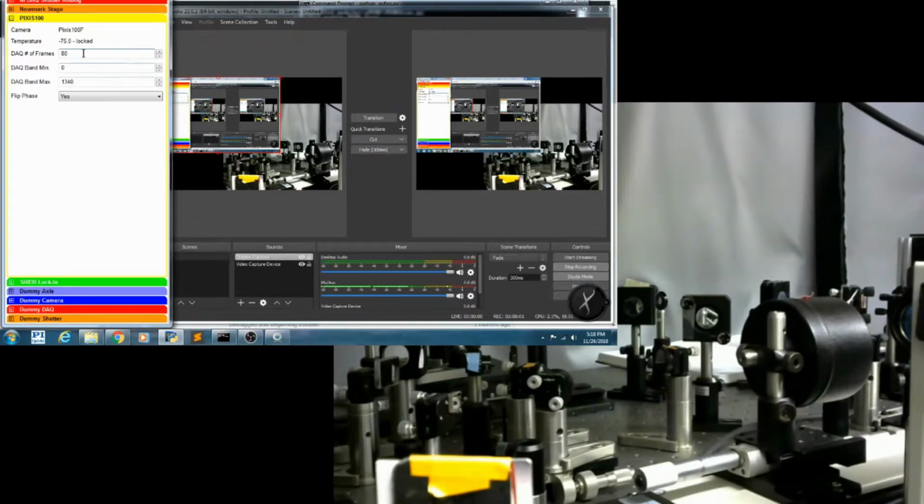Here the PIXIS 100 is the CCD camera, which again we're triggering from the regenerative amplifier and the shutter driver, or chopper driver. We can tell it how many frames to average. We can tell it how many pixels to read out, and you can flip the phase with respect to the triggering.